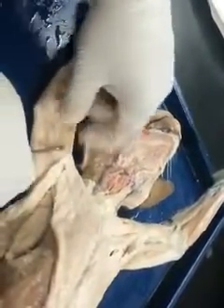If we move to the arm, or the brachium, where do we, you guys did this side, right? Yeah. So on this side, we'll have the epitrochlearis, which is kind of still intact here. You see this muscle that I'm just deep to? This is that epitrochlearis. So we're going to reflect the muscle.